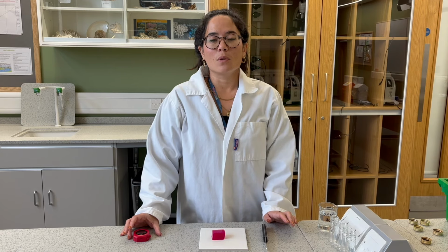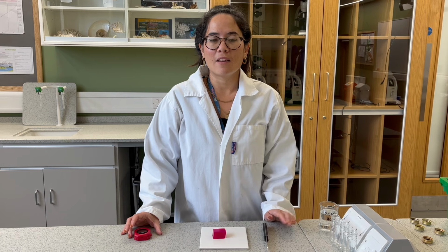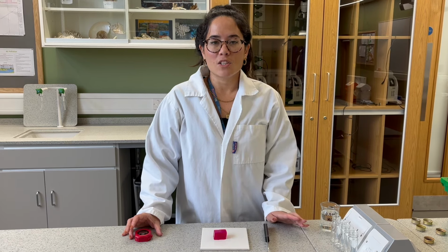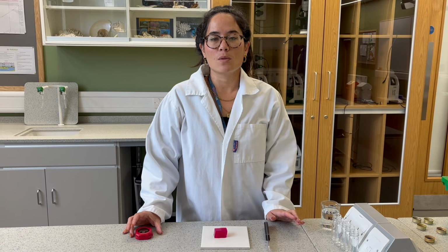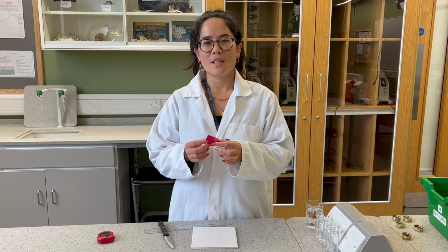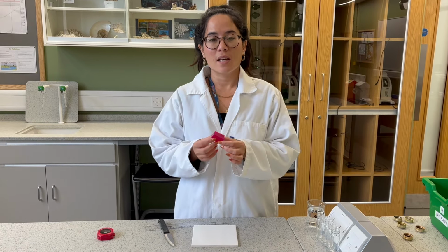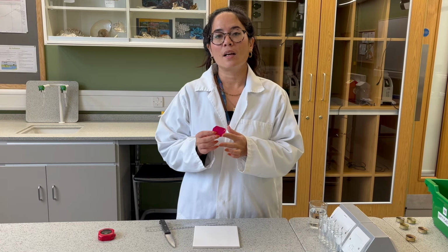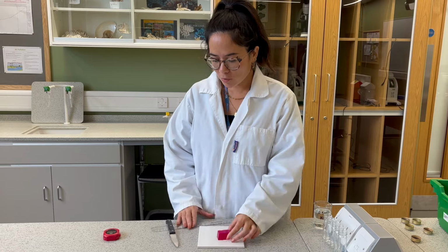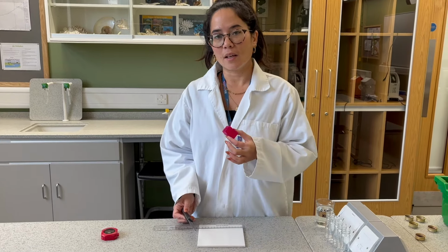Today's experiment is all about using agar jelly to look at rates of diffusion, and by comparing small agar blocks, representing the amoeba, with large agar blocks, representing the humans, we'll really be able to unpick the science behind this. So in order to study this, we're going to use agar jelly, which has been stained using cresol red. It has turned a pinky red colour, and it's done that in the presence of alkali. We're going to use our ruler and our knife to cut small blocks of agar jelly.